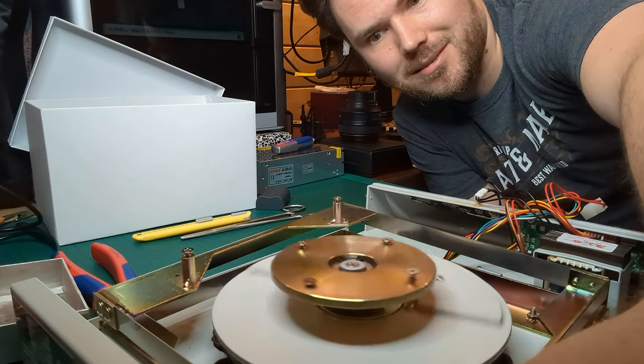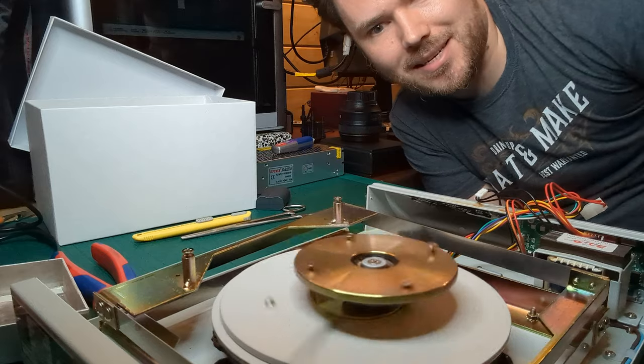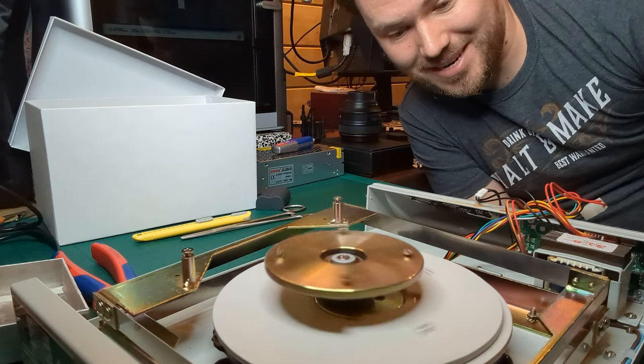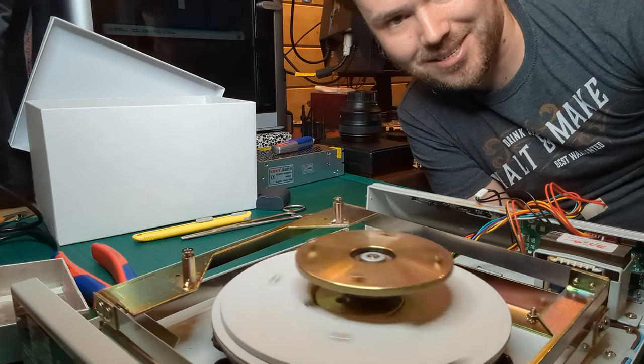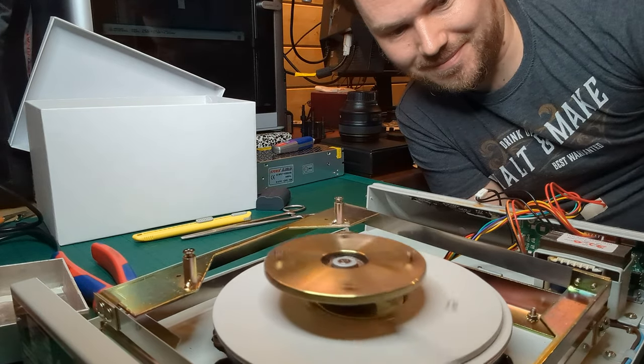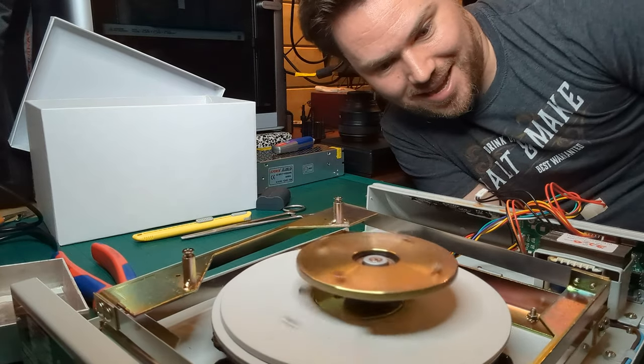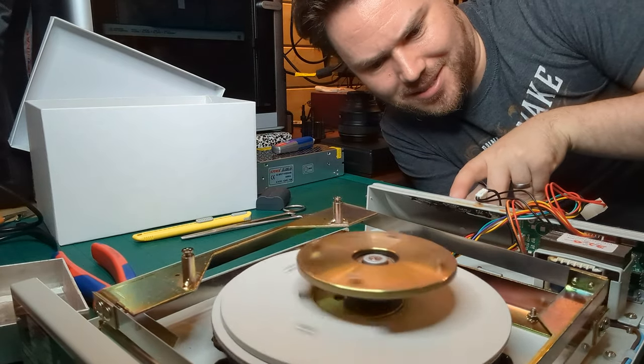Okay. I mean, it's spinning. That is unexpected. And the screen says that it is spinning. So, I mean, that's it. That single part was all that needed to be replaced. Let's see if the on-screen controls work.